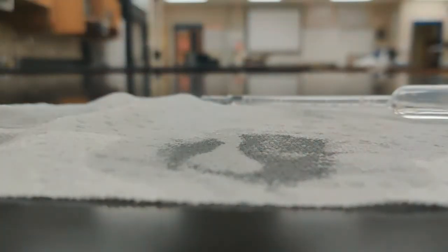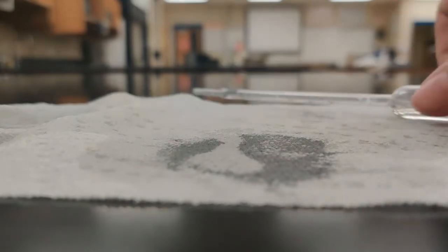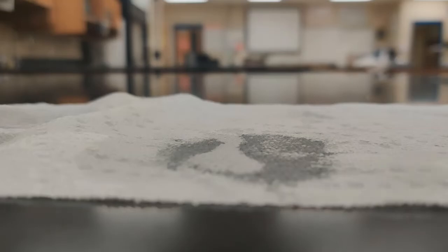So now that we've seen the surface tension of water, we want to think about our hypothesis here. Our question is, how does soap change the surface tension of water? You want to write a statement that says something like, if we add soap to the water, then what should happen to our surface tension? Should it be higher or should it be lower? And it's a hypothesis, so it's okay if it's not correct. We learned something if our hypothesis isn't correct.